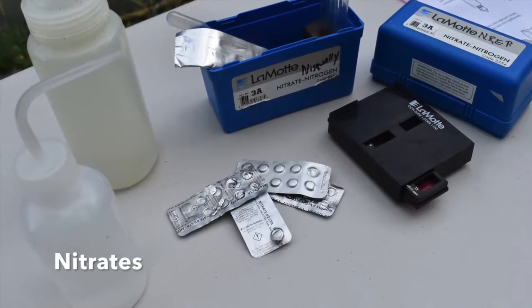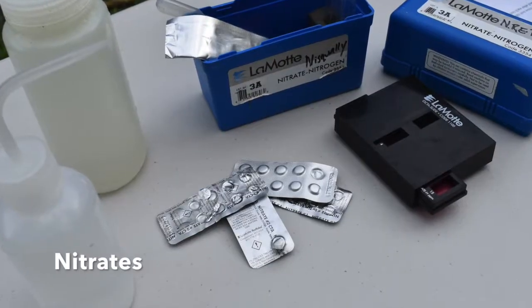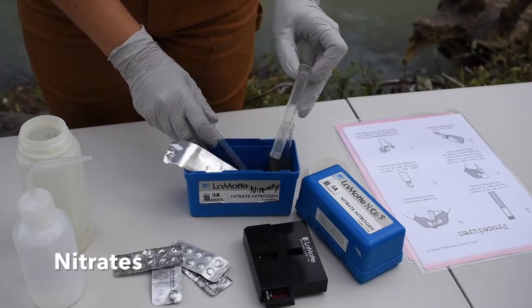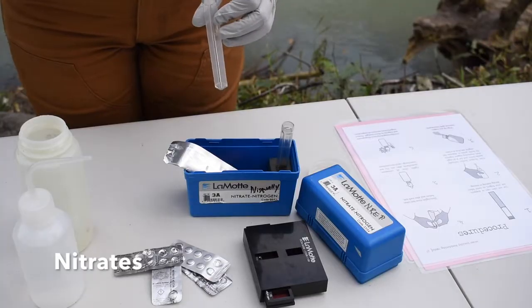Here are all of the supplies you will need for this test. First we fill one test tube with 5 ml of sample water.